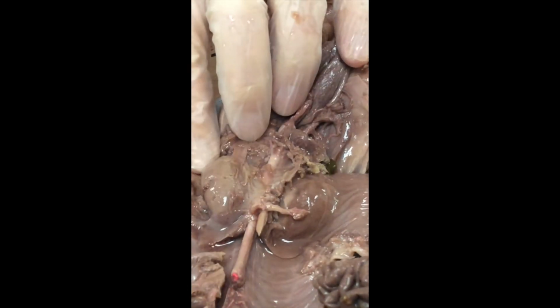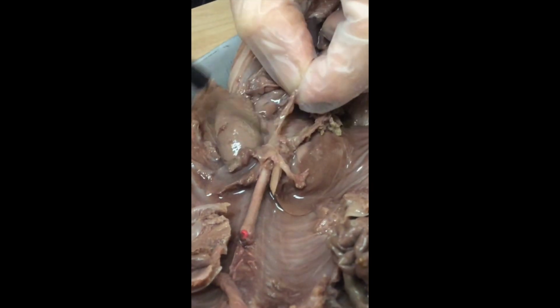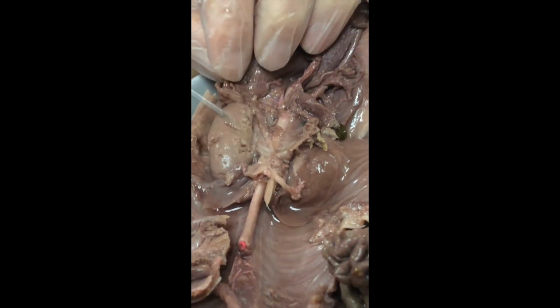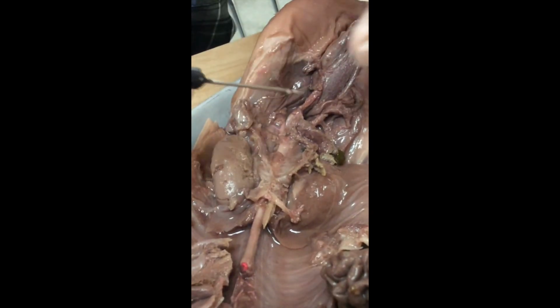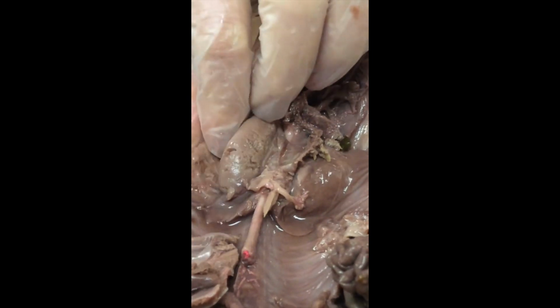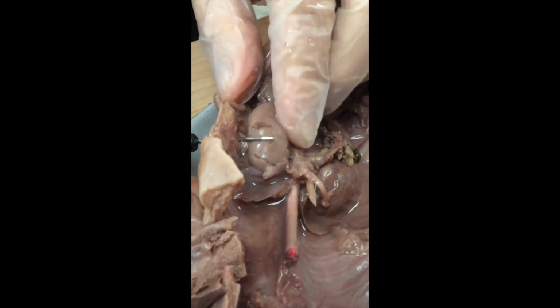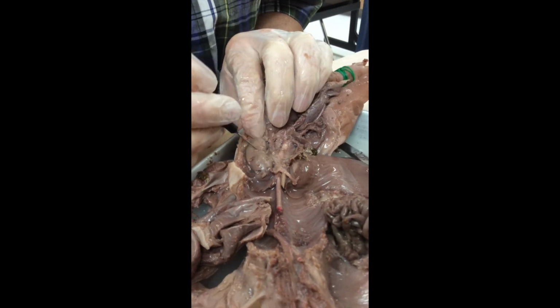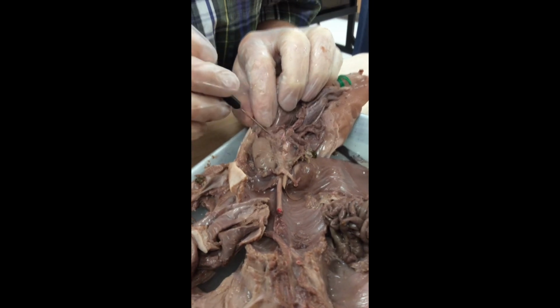Now, you might notice I have teased away the walls of the abdominopelvic cavity, and my goodness, we have exposed another organ right here. That's a kidney. The kidney is literally embedded in the wall of the abdominopelvic cavity. It's not in the cavity, it's in the wall of the cavity. There's very little tissue that protects it. I'm going to show you the bottom of the rib cage is about right here. And so we've got quite a bit of kidney that is exposed below the ribs. That makes those kidneys a little bit vulnerable to getting damaged.